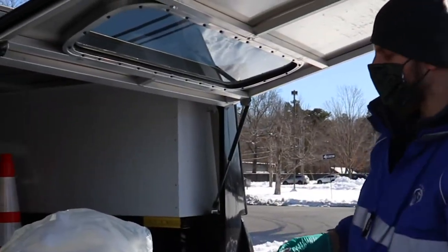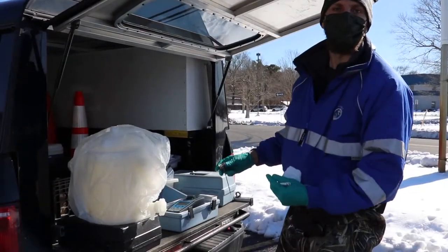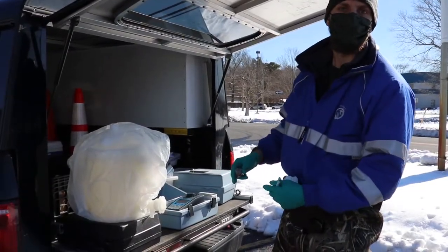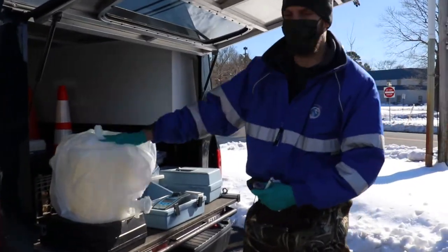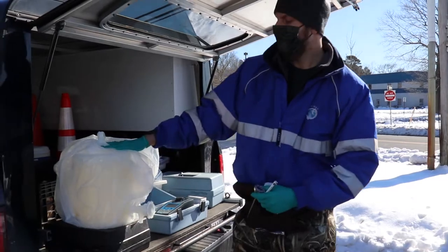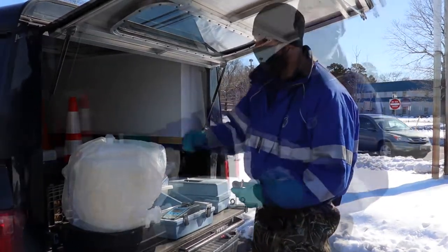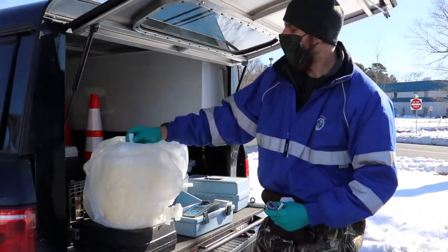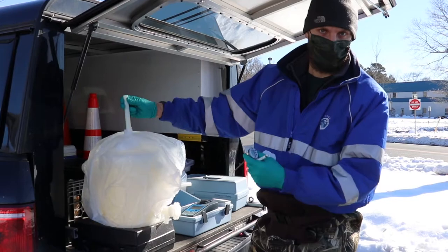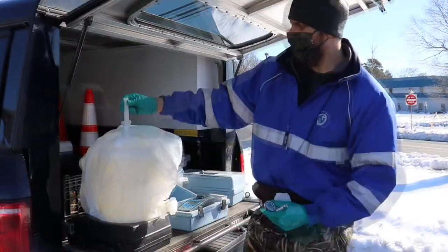First thing we do when we get back to the site is we want to perform a turbidity measurement on the water sample that we've collected in the churn. So what I do here is, quite literally just like churning butter, I agitate the sample using the agitator.